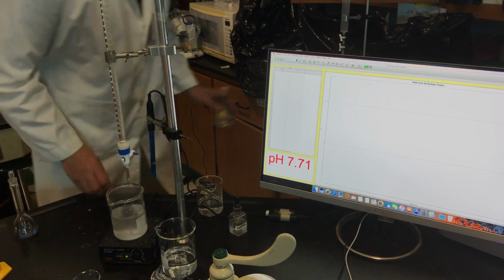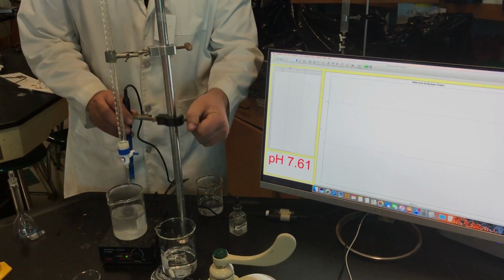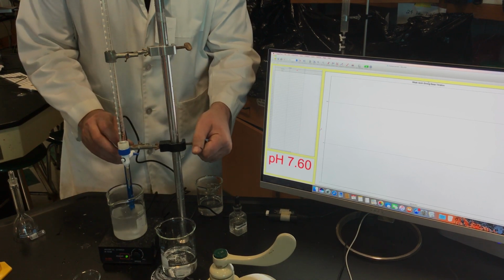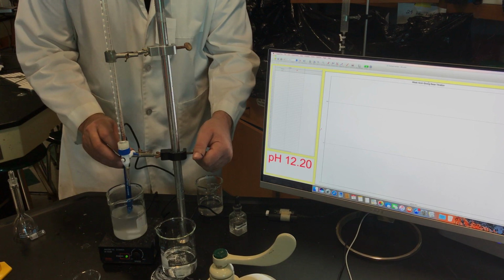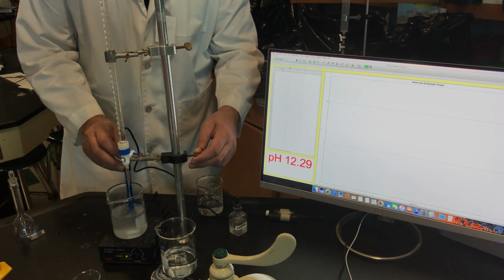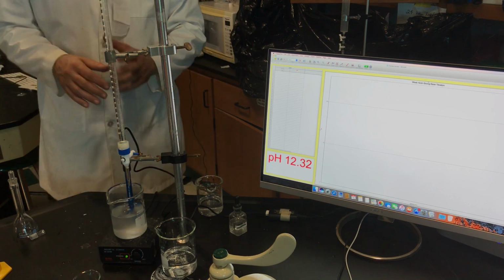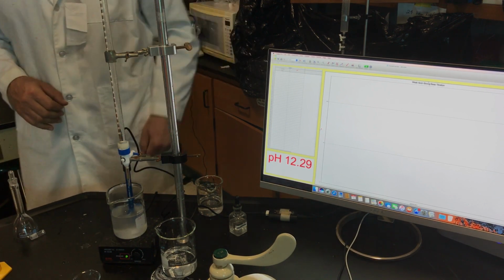Okay, now we're going to put the pH probe in a solution. It should be acidic. No, it's basic, right? I'm sorry. Yeah. Didn't we overshoot the solution? Yeah, we added excess base, so it makes sense that it's basic. So we're going to start high and go down.